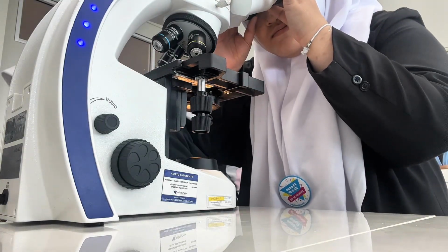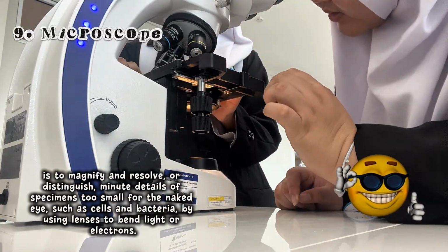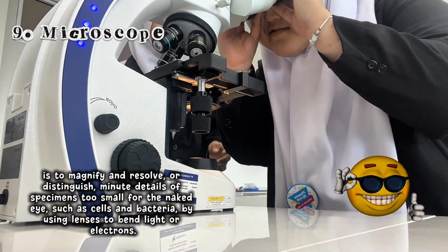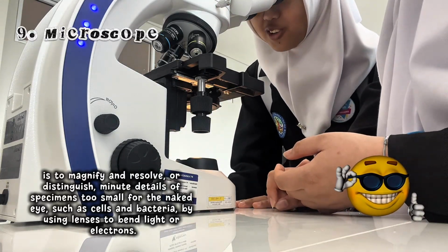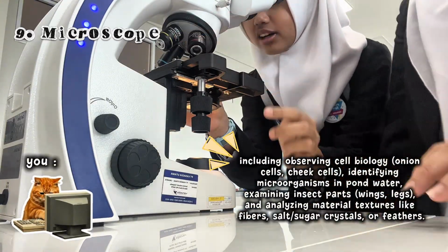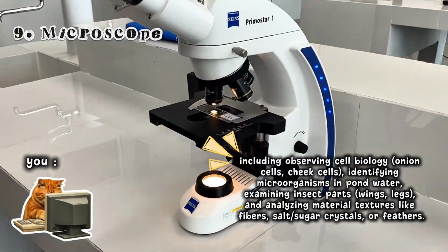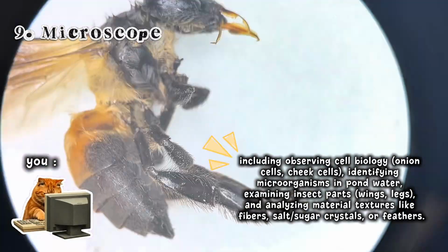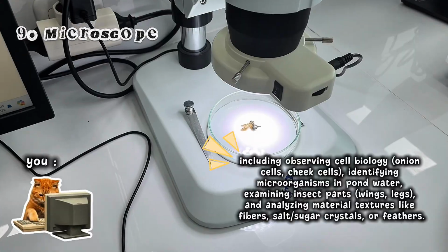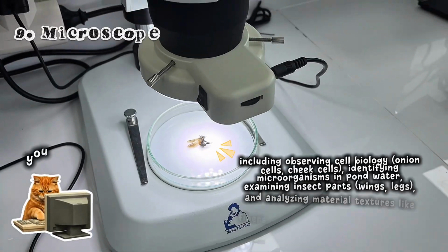The equipment that they have in this laboratory is called the microscope. It is used to magnify and resolve details of specimens too small for the naked eye, such as cells and bacteria, by using lenses to bend light or electrons. Experiments that use this equipment include observing cell biology, such as onion cells and cheek cells. Next, identifying microorganisms in pond water, examining insect parts such as wings and legs. And the last one is analyzing material textures like fibers, salt or sugar crystals, or feathers.